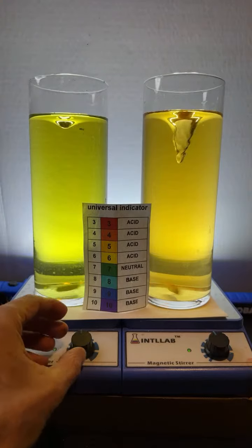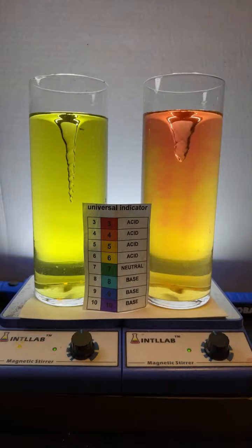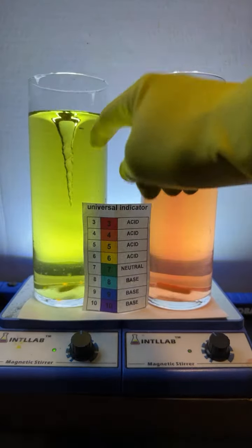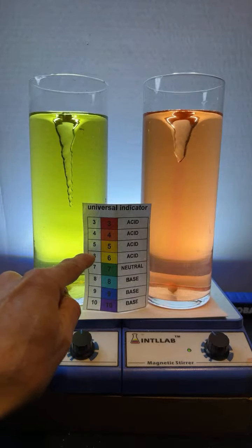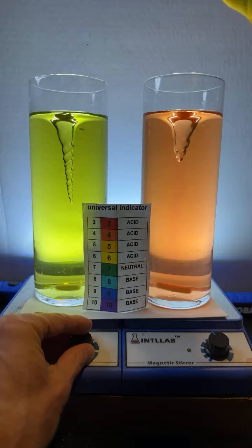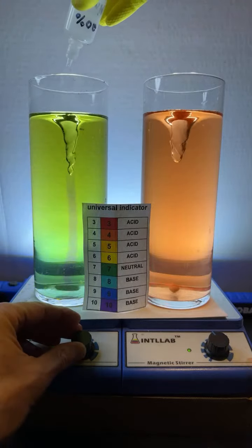Let me tell you something here that's kind of related to the hurricane that's going on. Let me get some acid added here. So over here on this side, actually, it's probably going to work better over here. Let's add it over here. So on this side, I'm going to add some sodium hydroxide base, which is going to increase the pH. So right now we're at yellow. But watch what happens when I add. I'm going to turn the speed down just a bit. I'm going to add some base. So in it goes.